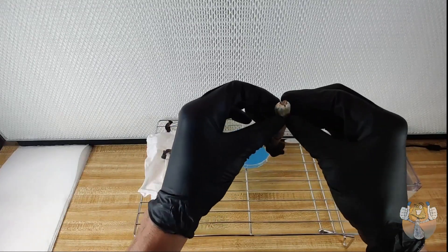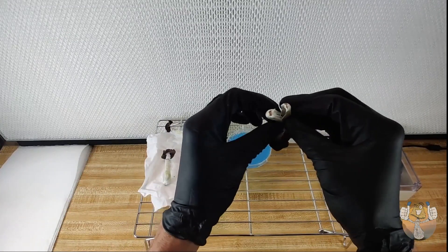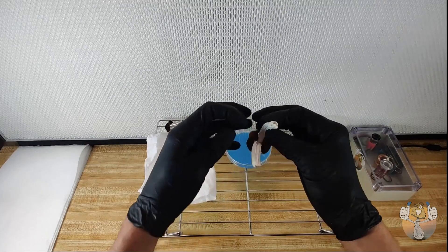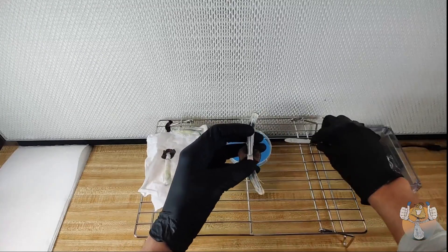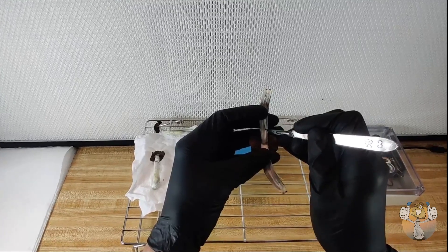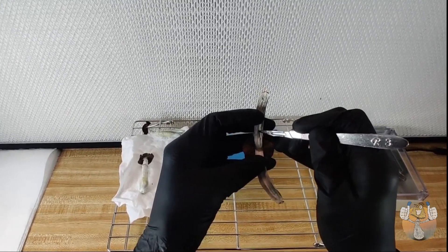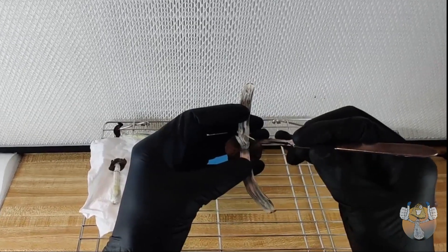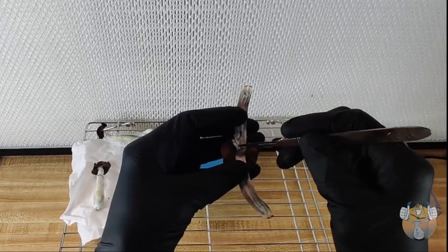So I'm going to go ahead and take this fat boy right here. We are going to split it right down the middle. We already sterilized our scalpel in our handy dandy Easy Blue Thumb induction sterilizer, which can be made to order. Just hit me up on Instagram or the Discord server.